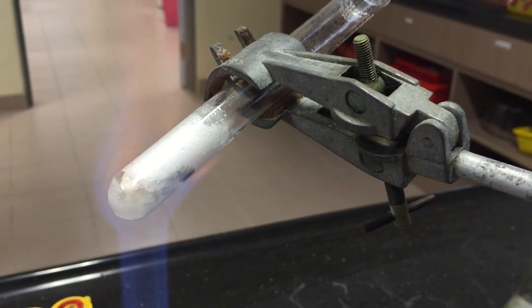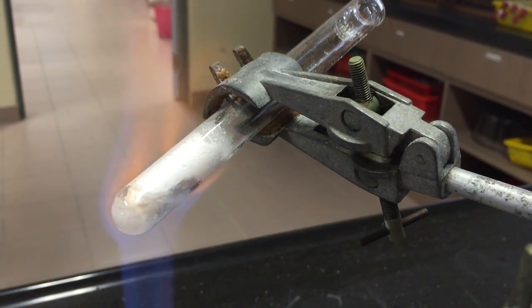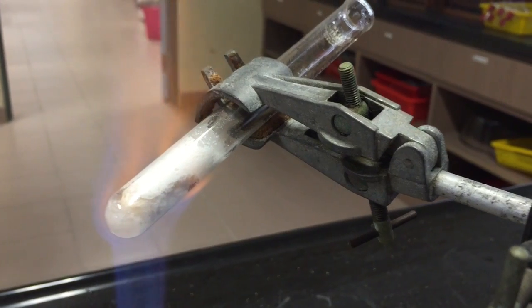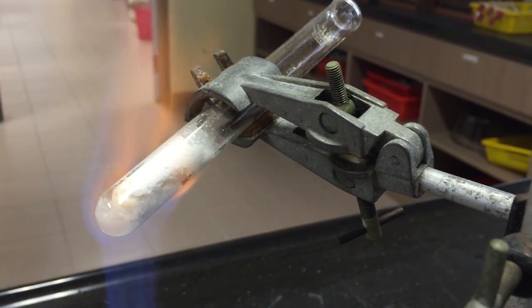As you heat the anhydrous calcium nitrate, you will notice that this time round, it really does melt. And as it melts, it decomposes.